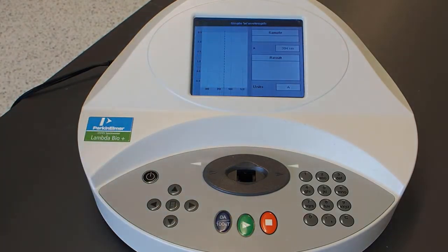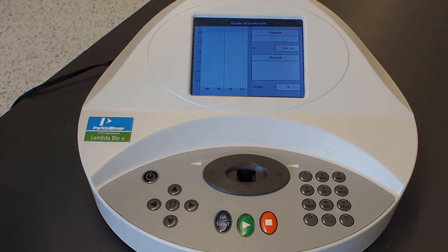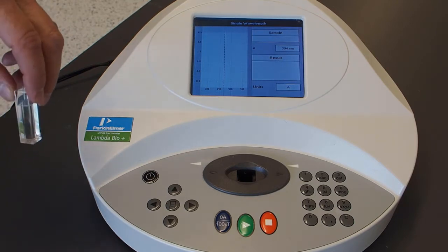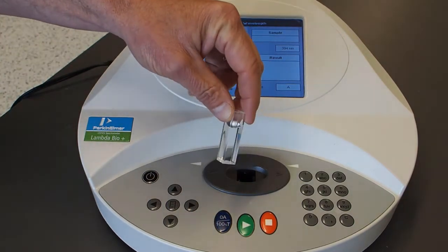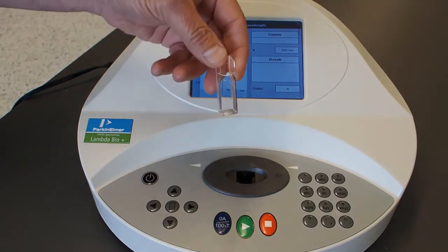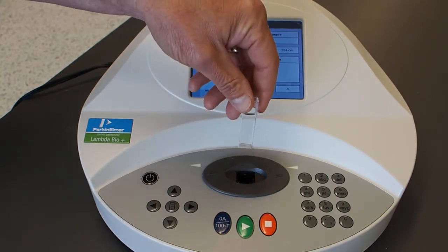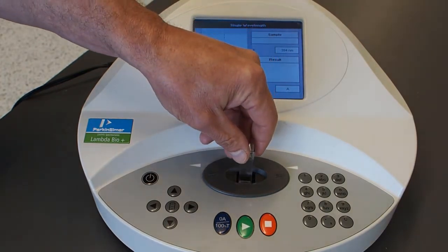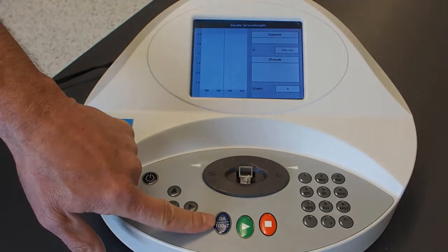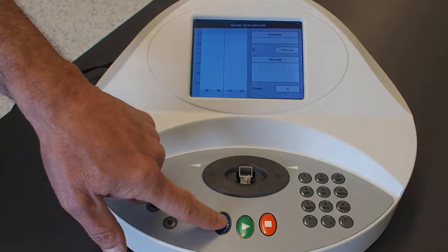Before we can measure our samples, we need to tell the spectrometer what the energy going to the detector is with no nickel in the sample. To do that, we use something called a blank — a solution that has everything in it except the compound you care about, so in this case just water. A blank uses the same kind of cuvette and the solvent you're using. We put that in the cell holder and press this button for zero absorbance, 100% transmittance — meaning that's the sample that has nothing absorbing at the wavelength you care about.